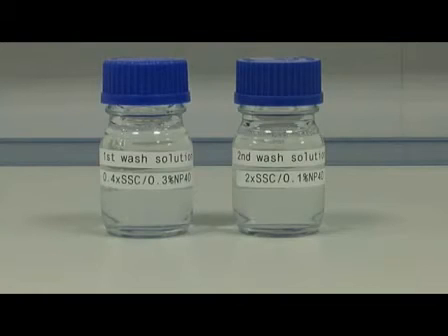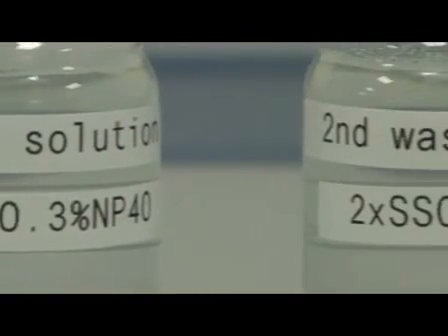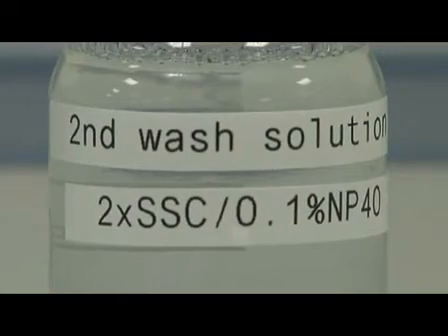In the final part of the protocol, we are going to use these two wash solutions made up of different concentrations of saline sodium citrate solution and the detergent NP40.